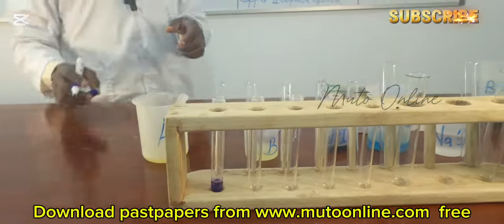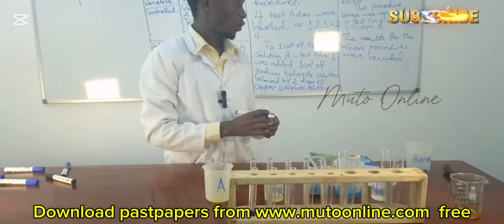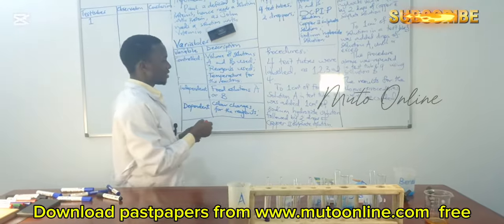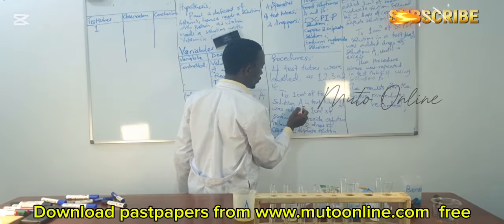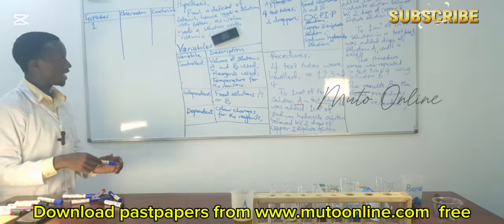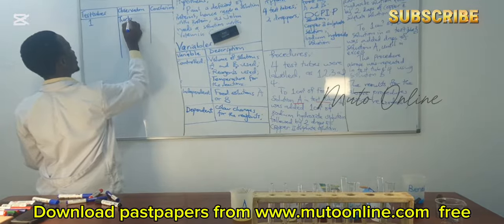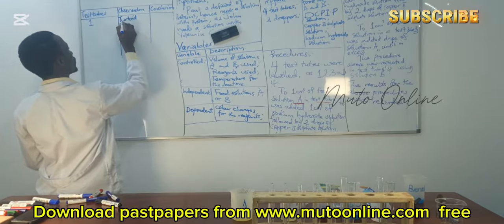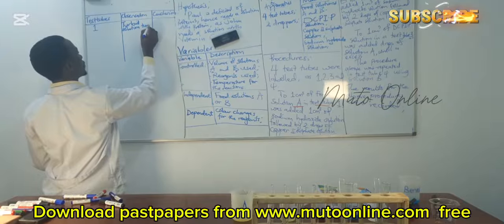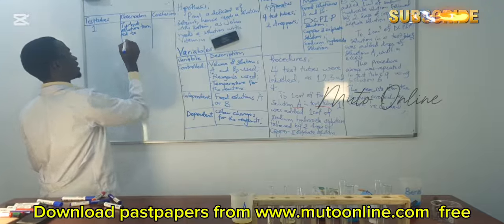What was the nature of the solution? Is it as colorless as the solution? Because we have how many tests in this procedure? We have putting solution A in a test tube. What was the nature of solution A? It was a turbid solution. So you come and say it is turbid solution, because you did the investigation.